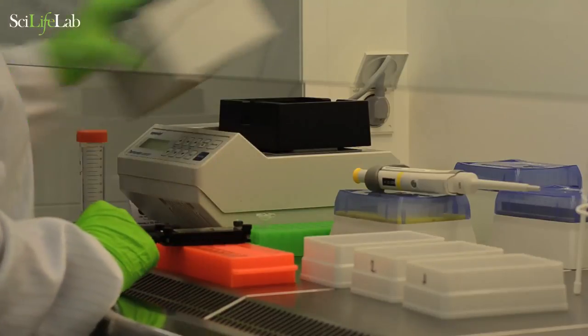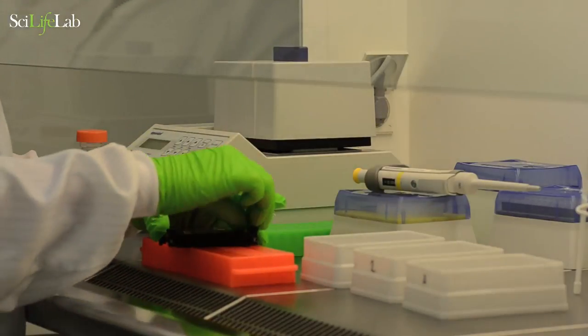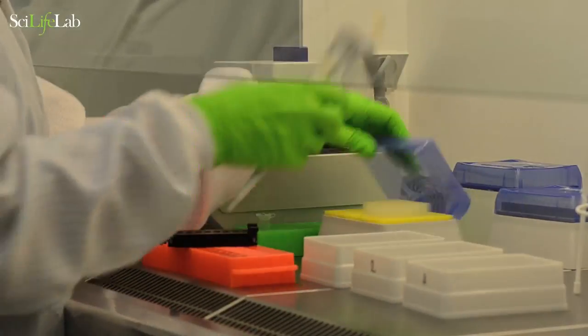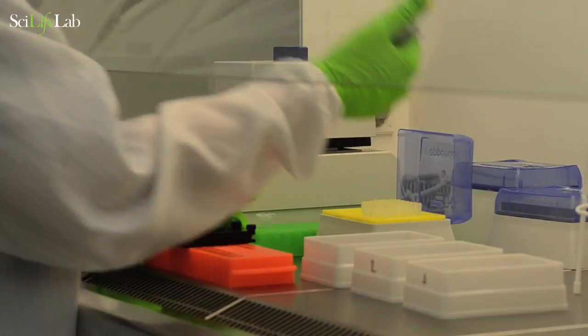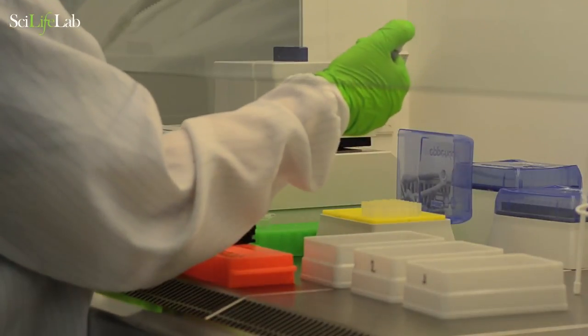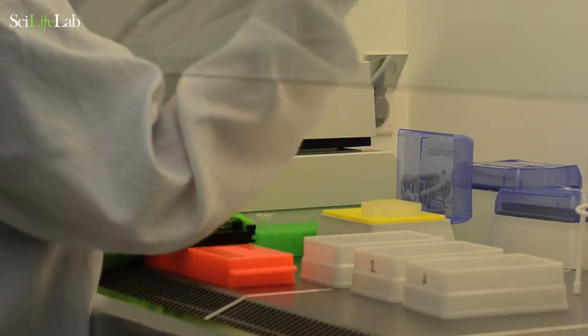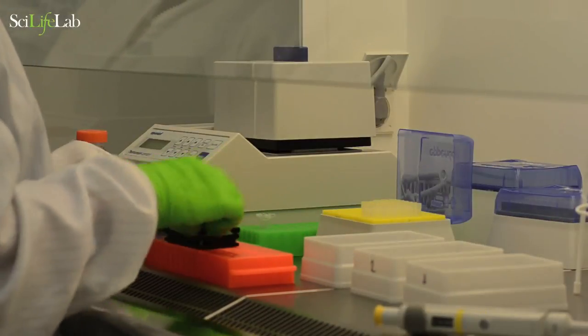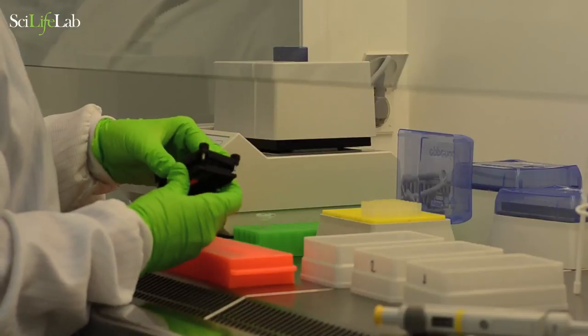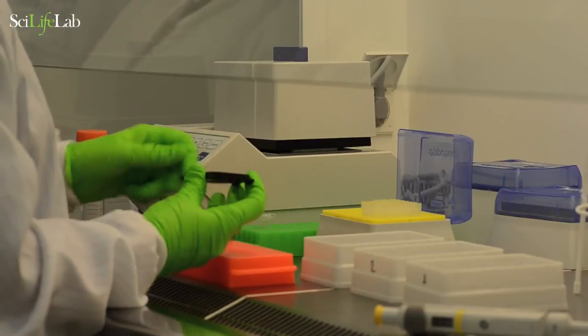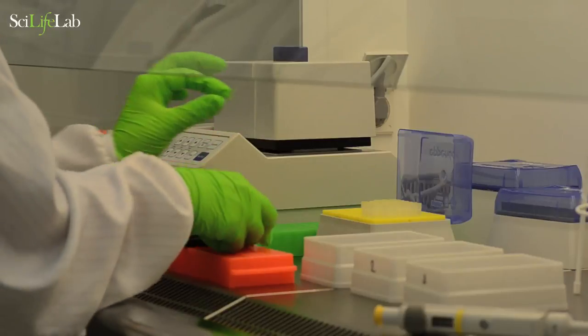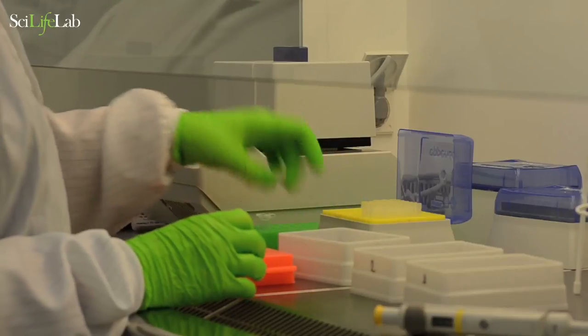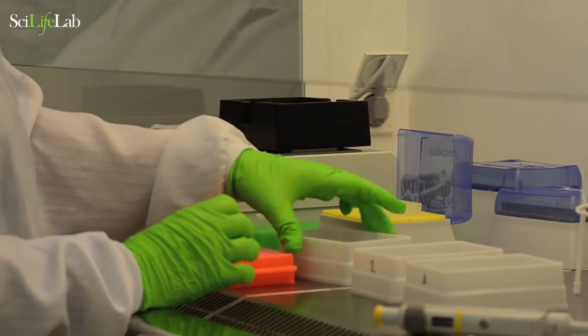After the proteinase K treatment, remove the seal and remove the mixture. Disassemble the microarray cassette and place the glass slide in pre-warmed wash buffer number 1. Incubate at 50 degrees for 10 minutes in a shaking incubator.